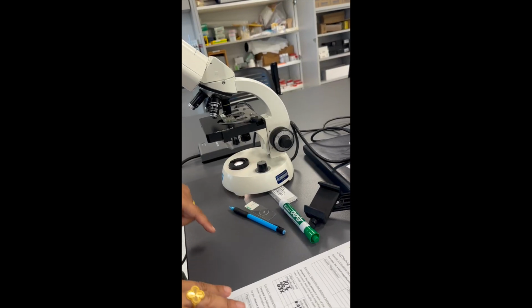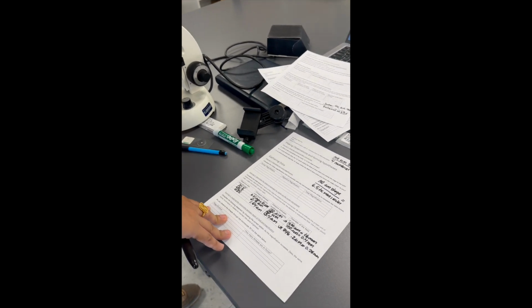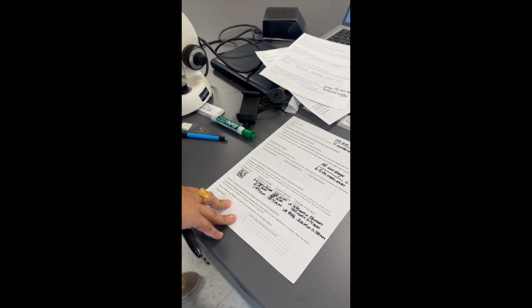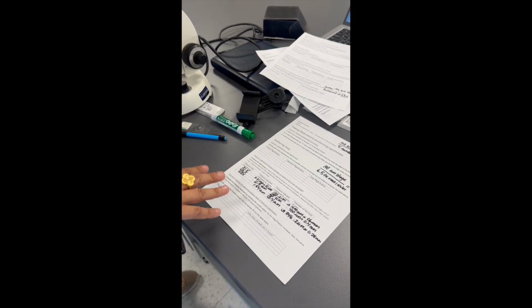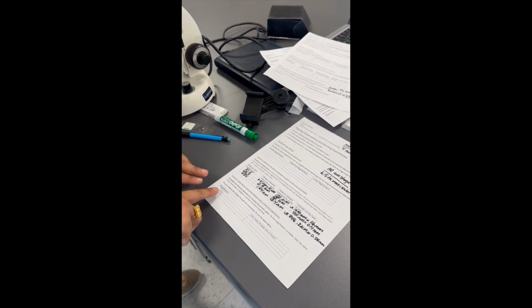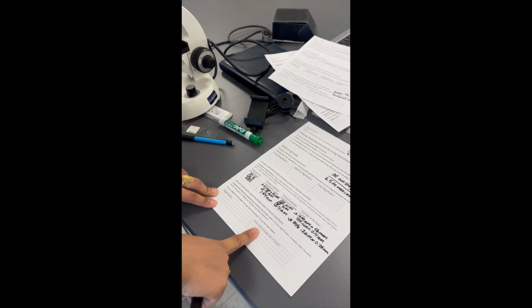Next exercise is exploring the relationship between depth of field and magnification using our cross fibers microscope slides, where we have 3 threads lit on top of each other. We have a blue thread, a red thread, and a yellow thread. Students are going to observe the threads in focus at various magnifications.